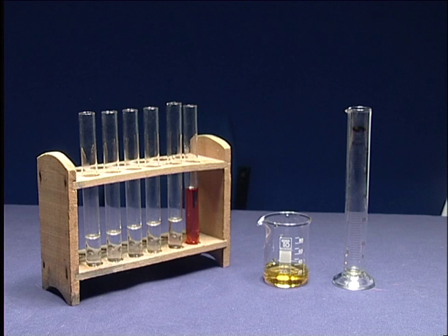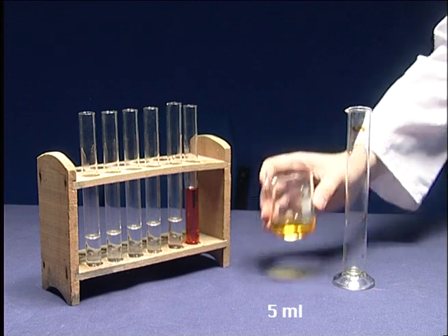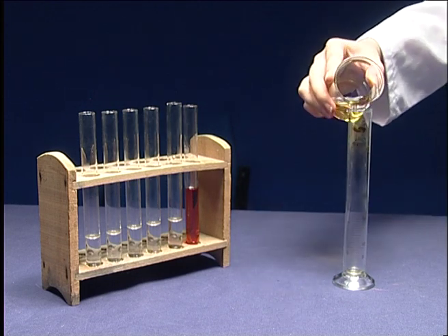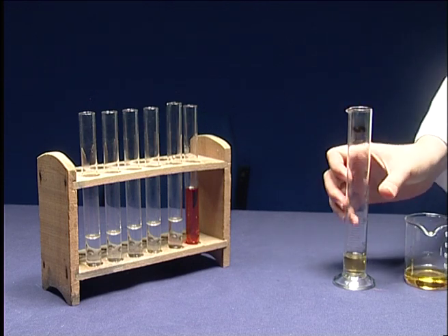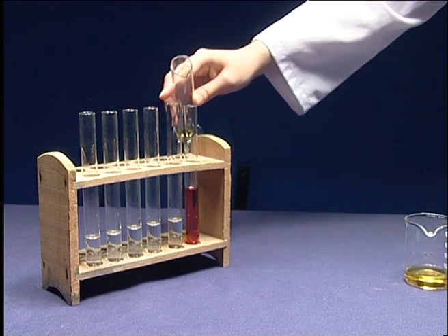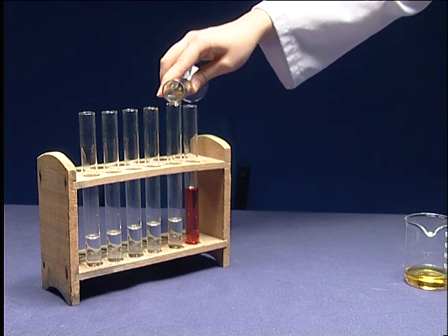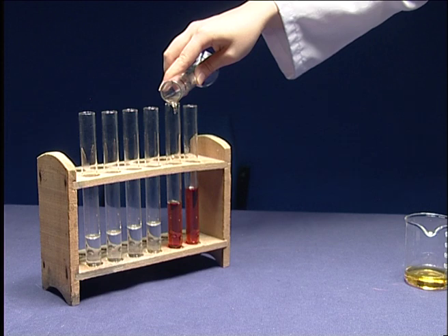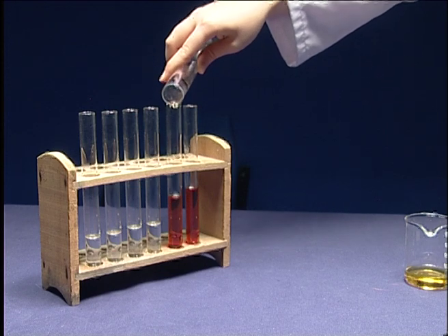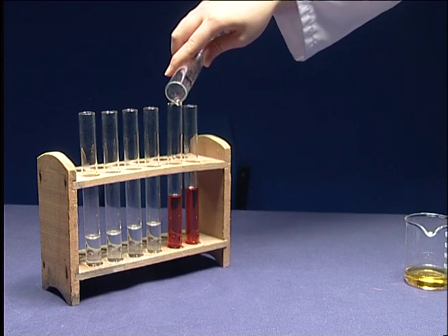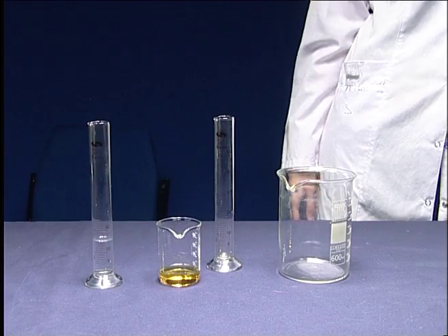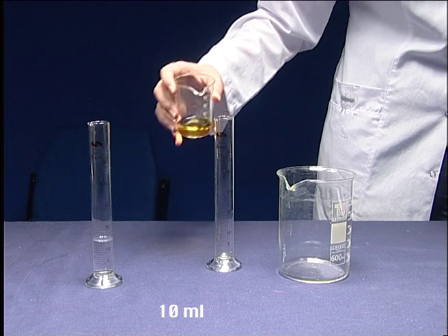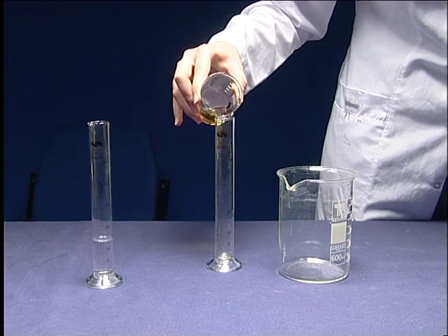Take 5 ml from this solution and add it into the second test tube. Take 10 ml from the solution you prepared and discard it.